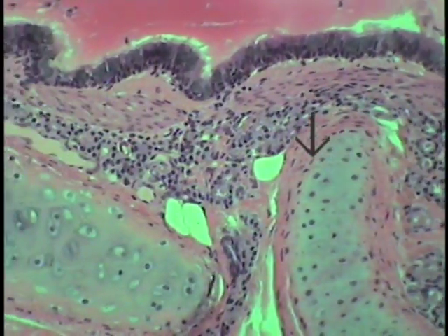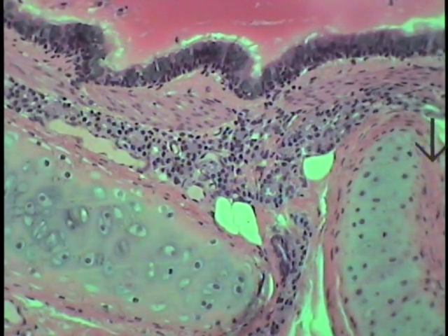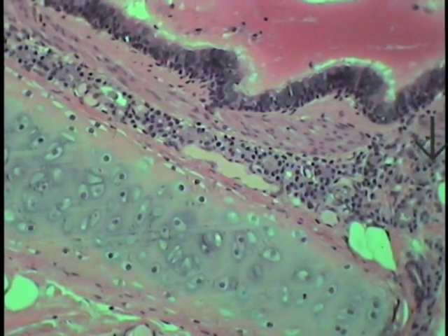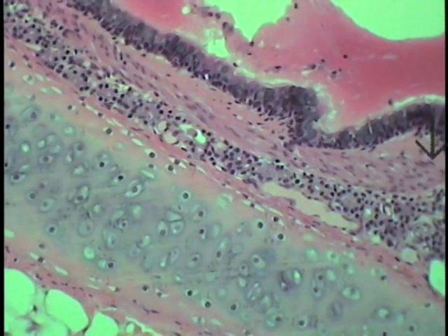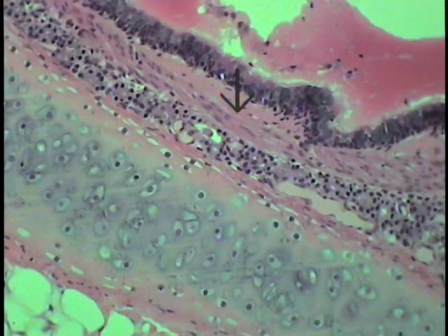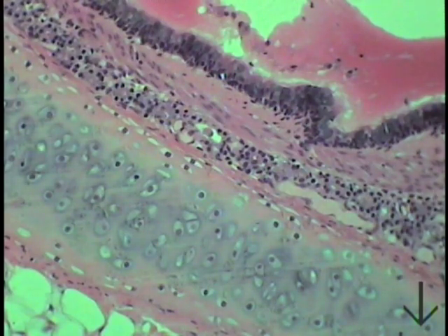And so we're simply moving the field now, showing you how these units repeat over and over again. A characteristic feature is the hyaline cartilage plates, a relatively thick, prominent respiratory type of epithelium, and now making its appearance in its well-established bronchial smooth muscle and bronchial glands also within the field.